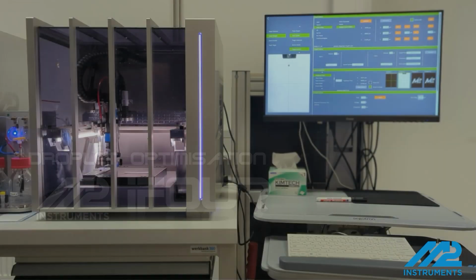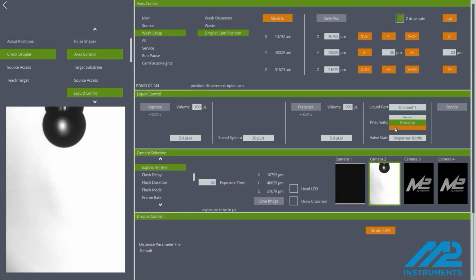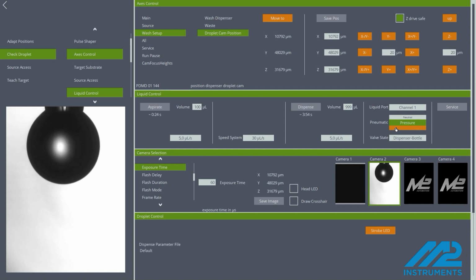This video demonstrates the live optimization of droplets using the built-in droplet camera in the iFOUR wash station. Firstly, the dispenser is flushed with system liquid.